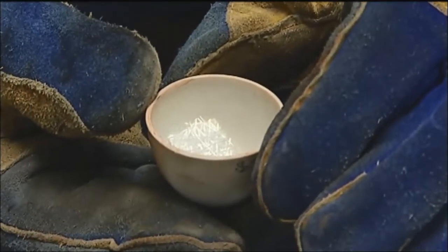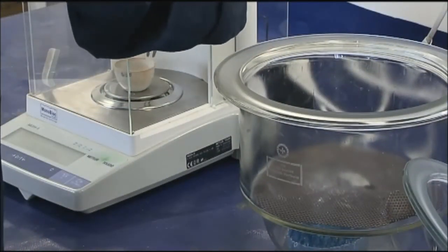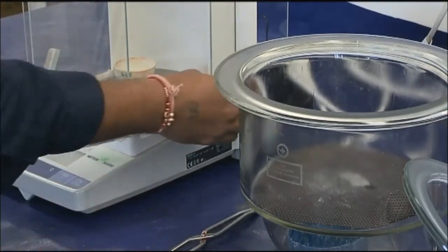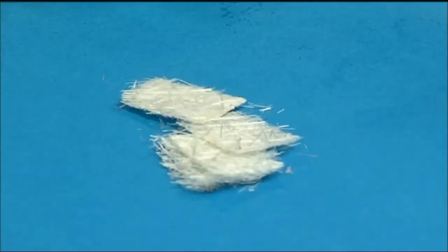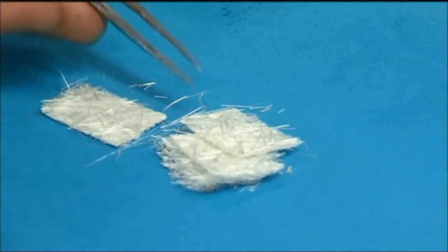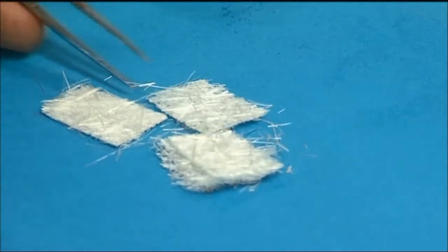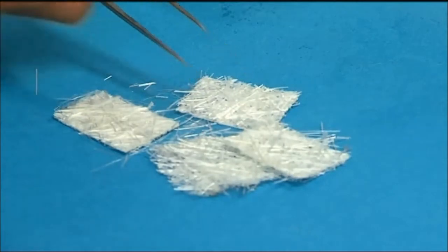The crucible and contents are cooled in a desiccator at room temperature and re-weighed. The remaining weight is the fibre content, and the resin content was the amount that was burned off. It is also possible to check the type of fibres used, the structure of the fibres, and its layup. Fibre fraction is expressed in percentage by weight.